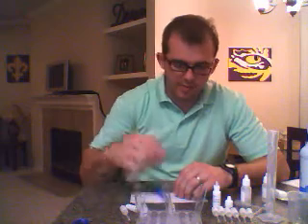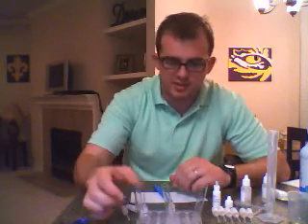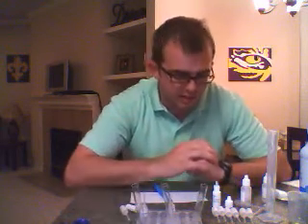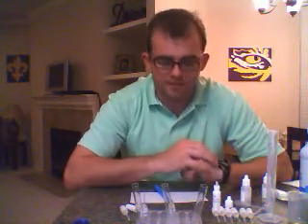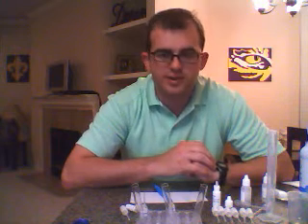And from there, I want to kind of do the same set of tests. I want to do some more tests in test tube number 3, and then I want to repeat all of this with all my other anions, and continue to make observations and record my data.